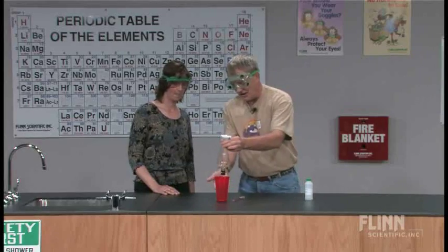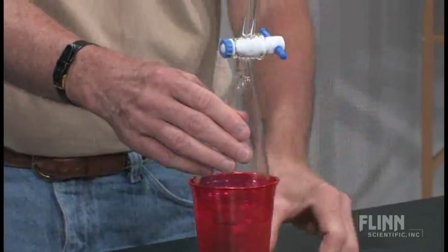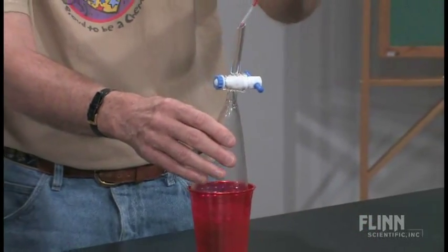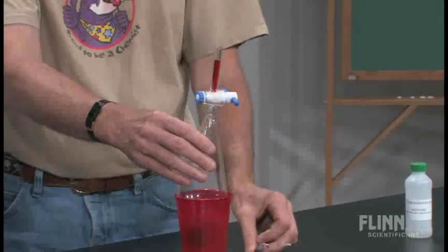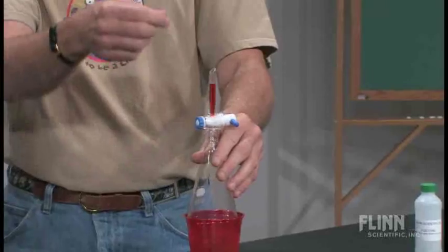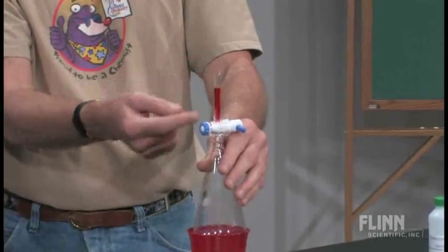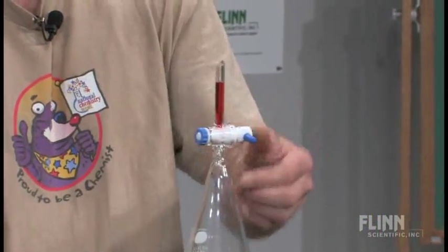So I've got some ice water inside this cute little red cup. And I'm going to make this easier so we don't have to listen to the sound. I'm going to put some liquid in the other end of this thing. And I'm just going to let it cool for a very short period of time. Lowering the temperature should lower the vapor pressure. So now the pressure on the inside should have gone down. If I open the stopcock, the red liquid in here should get pulled back inside. And we'll see.